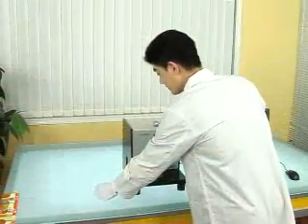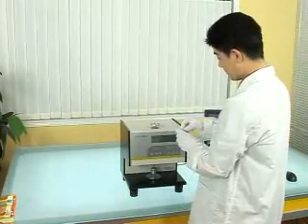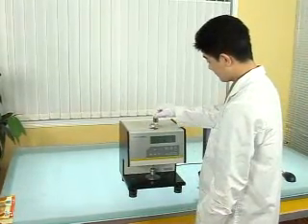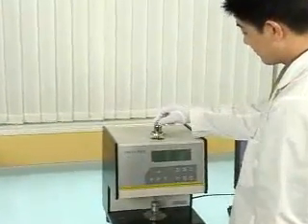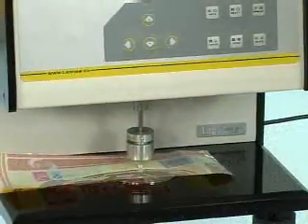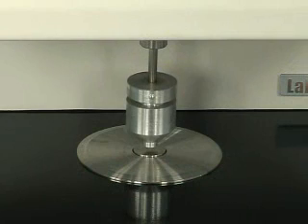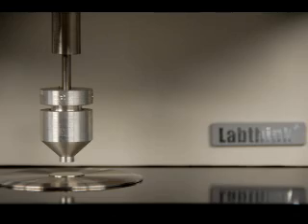Characteristics: Mechanical test method with no restriction on testing materials. Testing accuracy up to 0.1 micron with stable and accurate test results. Contacting area and pressure between testing head and film conform to relative standards strictly.